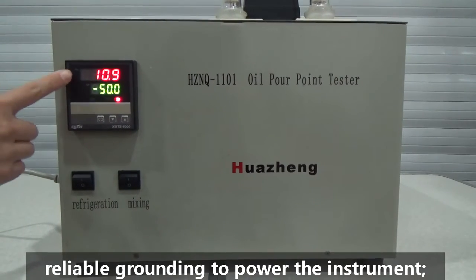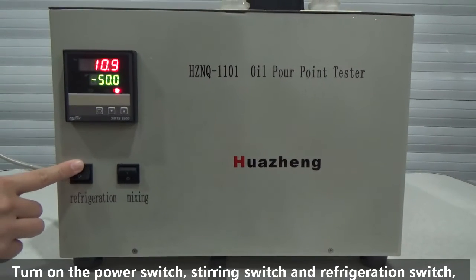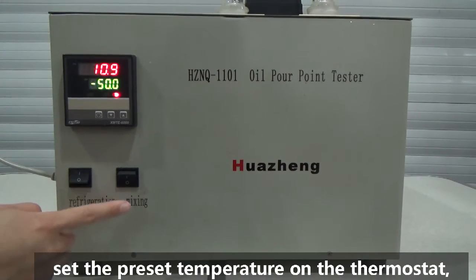This display shows the temperature. You can set the temperature. Now open it.